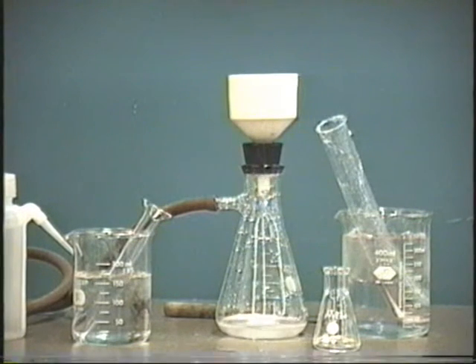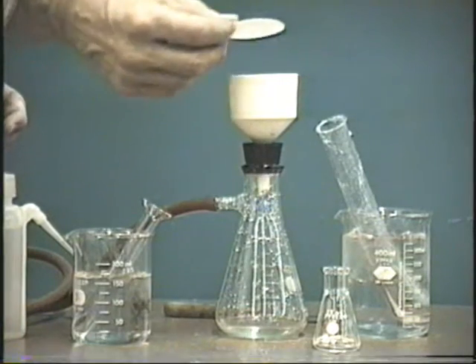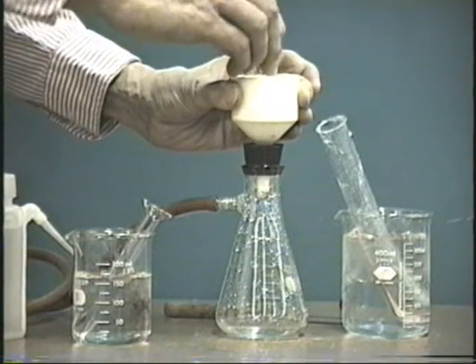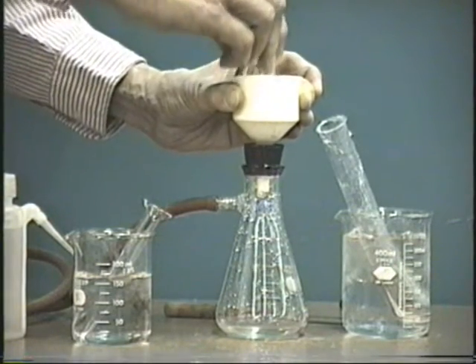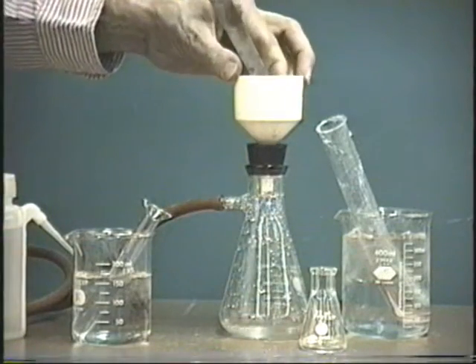And now we have put all of our sodium bicarbonate into the Buchner funnel. At this point, when it has sucked itself relatively dry, we'll take a clean piece of filter paper, dry, and put it right on top. And with a small Erlenmeyer flask or a rubber stopper, we will press this down. This way we will press down any additional water which may still be in the filter cake here. Then we will take out this piece of filter paper.